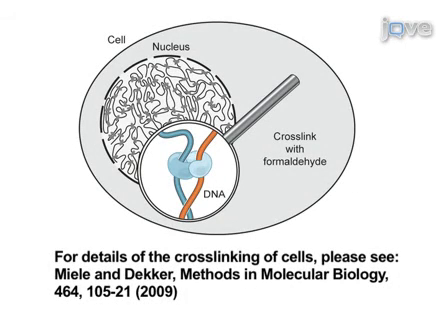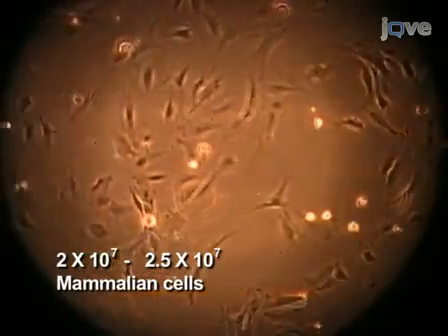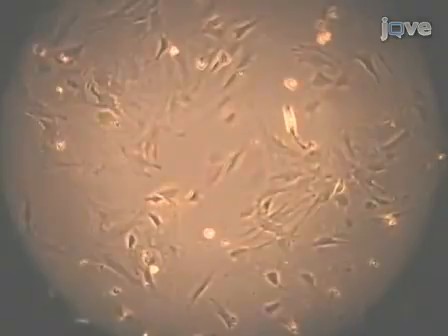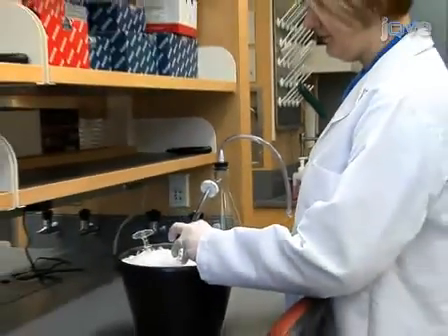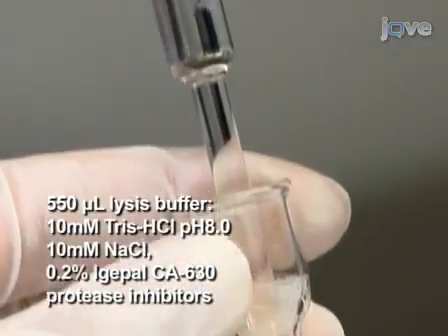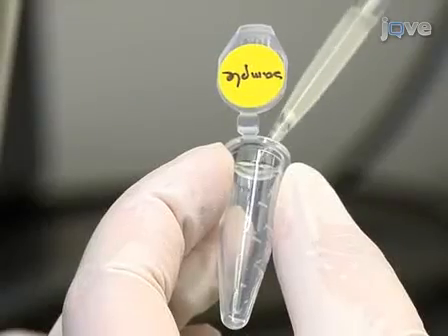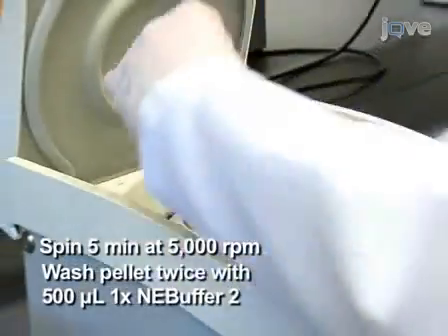Hi-C begins with cross-linking of cells, which is a common method in chromosome conformation capture. To begin, grow between 2 × 10⁷ and 2.5 × 10⁷ mammalian cells, either adherent or in suspension, and cross-link the cells. Lyse the cells in 550 microliters of lysis buffer using a homogenizer. Spin the chromatin at 5000 rpm and wash the pellet twice with 500 microliters of NEB buffer 2.